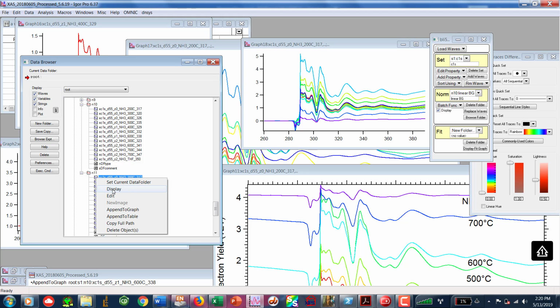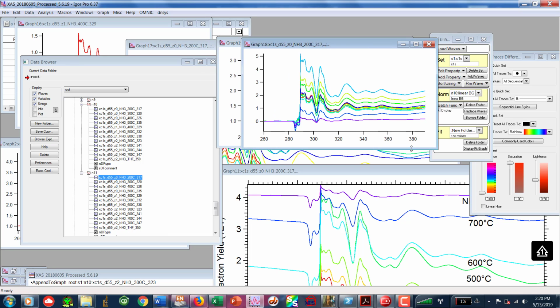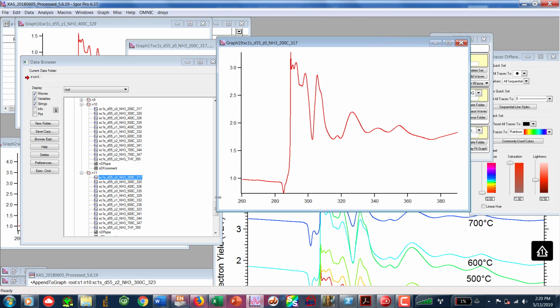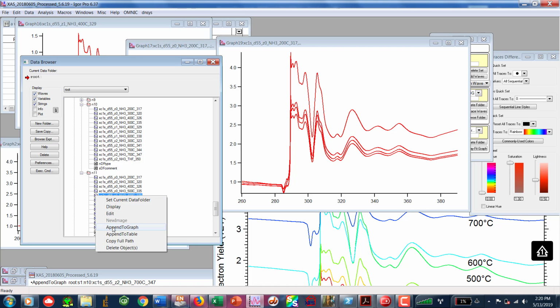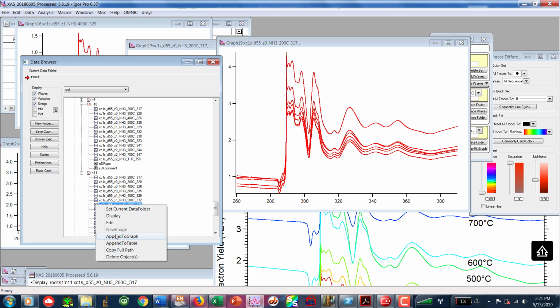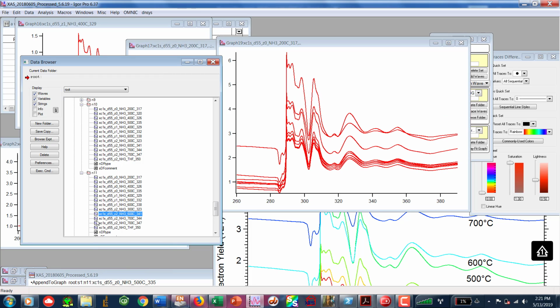So let me go ahead and say display. And we'll get that data up. I tried to do the batch way, but then it says the data set is too big, and I'm not sure why that is. That seems pretty silly to me. But anyway, we're going manual so we can get to what we need to do.